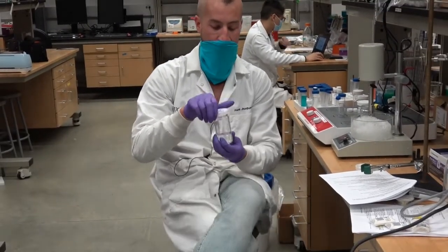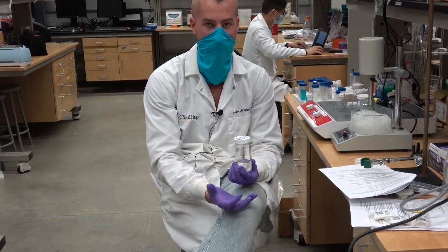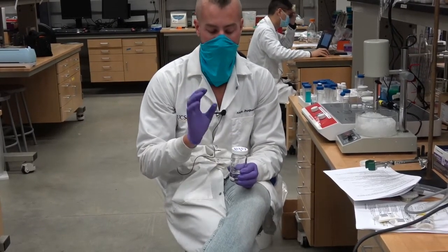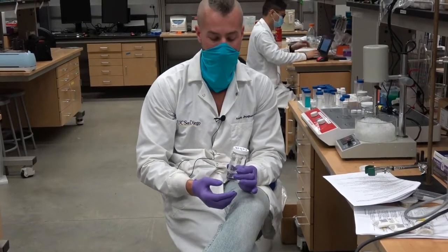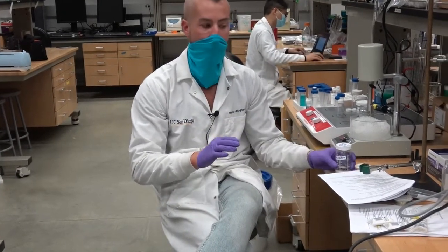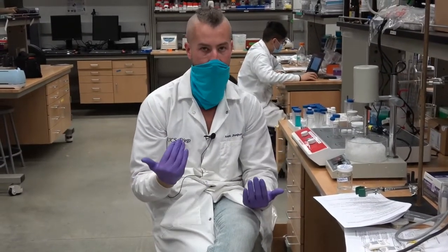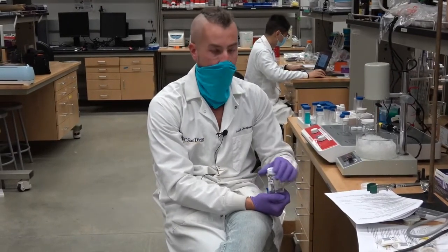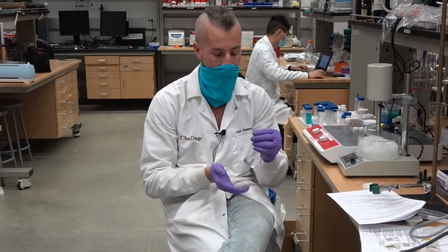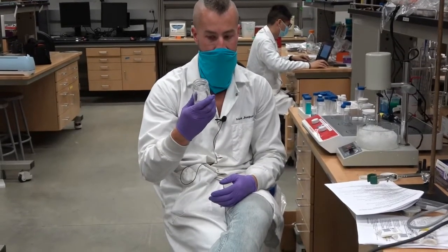Okay? I didn't do a very good job of explaining in the video, PVA. What PVA does is it helps stabilize these microemulsions of particles in the water. And if we didn't have this, no matter how much energy we put into it, it eventually would separate back into oil phase and water phase. And so that's why we can't just have plain old water. We need water with some kind of stabilizer. And that's what this is going to do. So it took us a minute to get it dissolved, but it is dissolved.